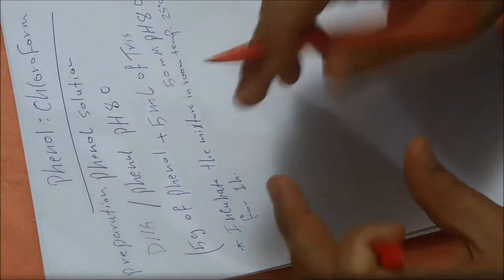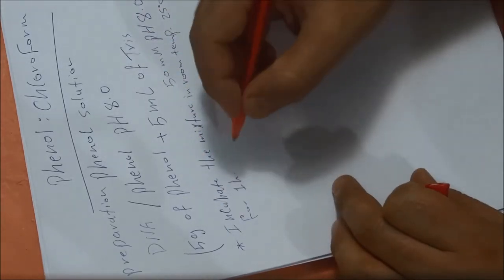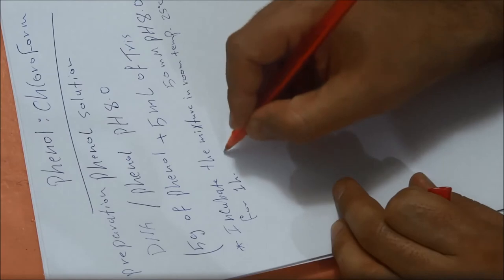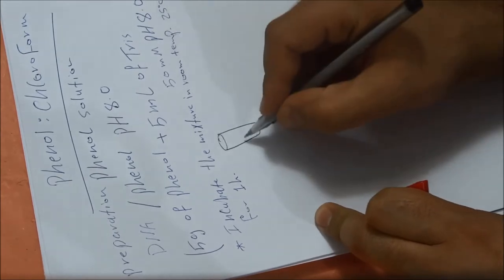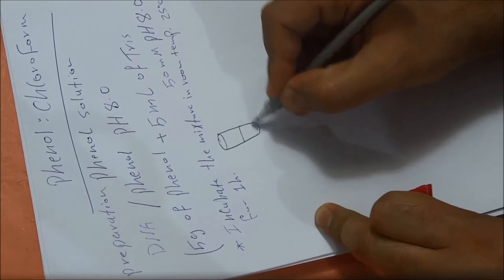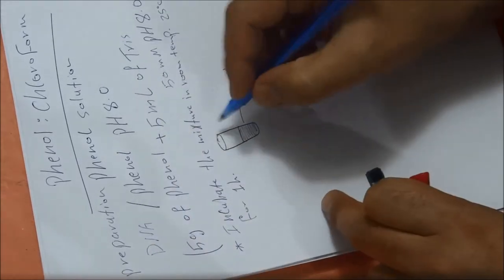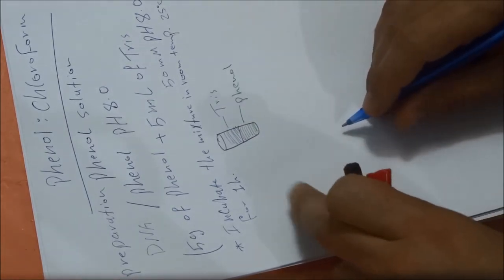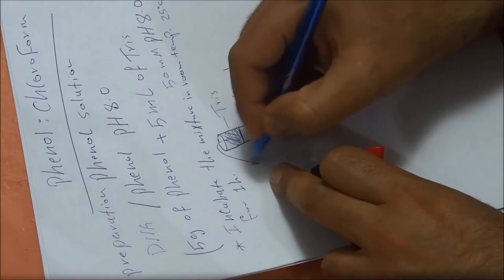This will lead to formation of two layers. After mixing the solution well and leaving it for about one hour, there will be a phase separation. All phenol will be at the bottom while the Tris will be at the top layer. After one hour you will remove all the Tris.